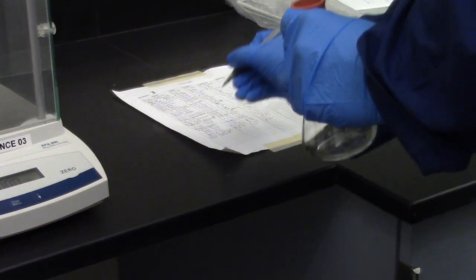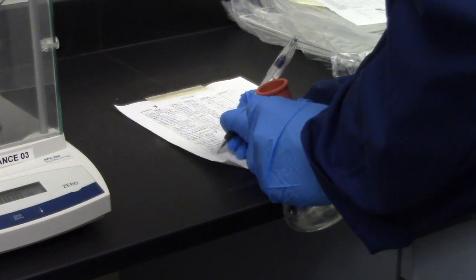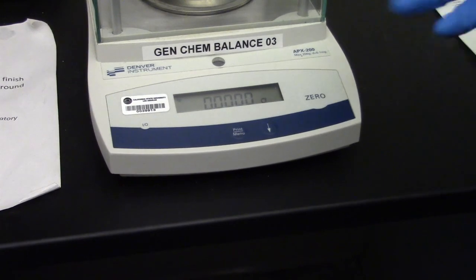Before using the analytical balance, make sure you log in. Zero the balance.